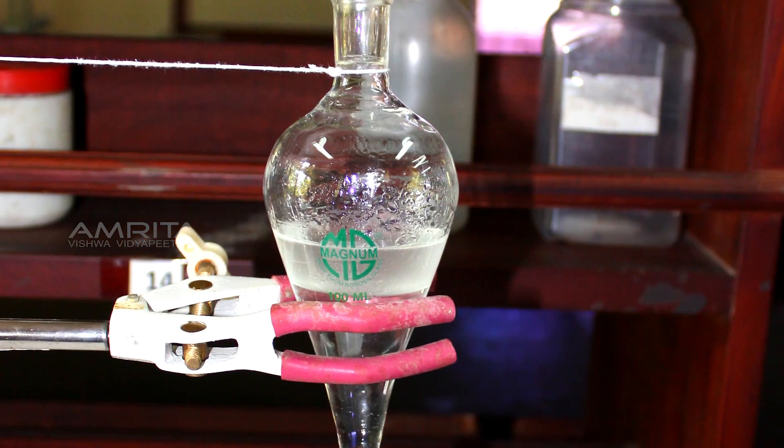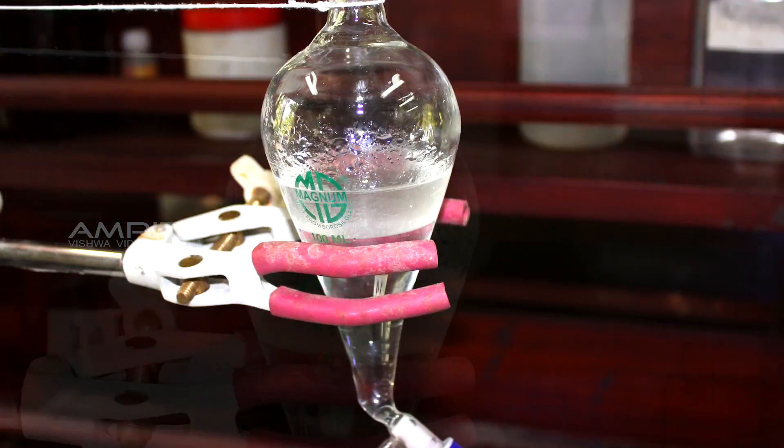We can see that oil forms the top layer and water forms the bottom layer.